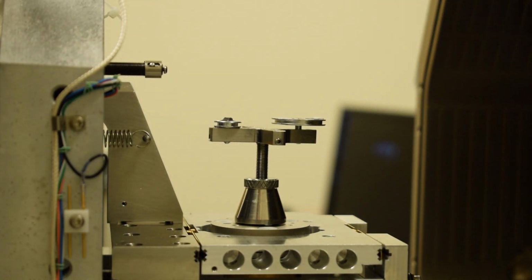Okay, so both samples are now secure. They're approximately at the same height. You should strive to position the samples within 1 millimeter height difference or less of each other. This should not be too much trouble. If you cannot get the samples within 1 millimeter height difference, then you should load one sample at a time. It can be very hazardous, especially if you're going to tilt the microscope stage to have different heights in the chamber at the same time.